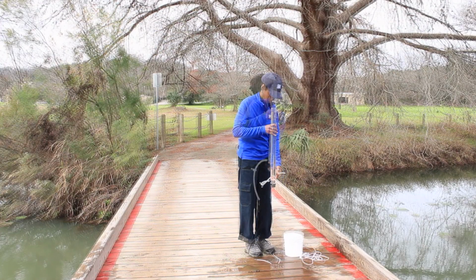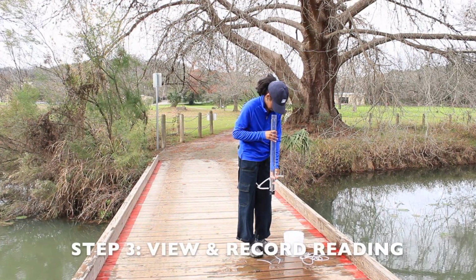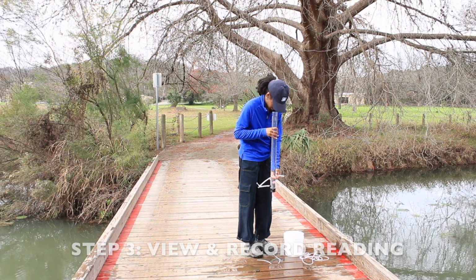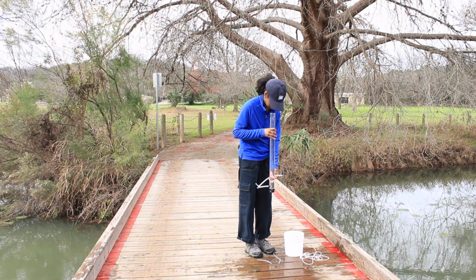For step 3, look down the tube to see if the disc at the bottom is visible. If the disc is not visible, release water until barely visible and record the transparency depth in meters, indicating the level of transparency on your core monitoring form.